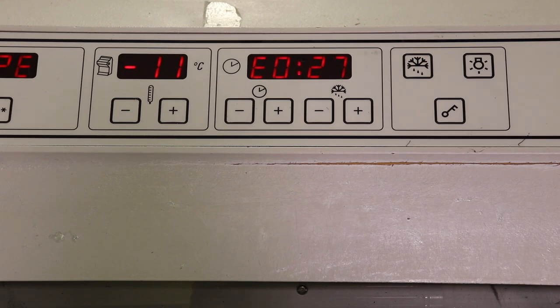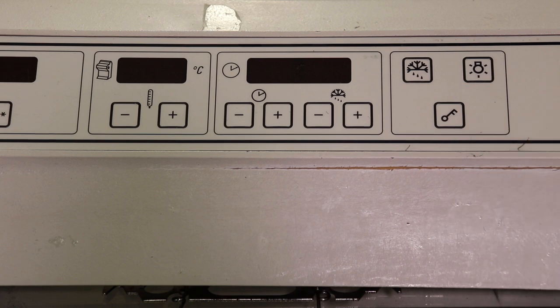Of course, there's always a situation where you can't get somebody out quick enough and you need to use the machine tomorrow. In that case, you can always turn the power off and open the window and let it defrost overnight, and all the ice will melt. When it's done, you dry your chamber out, close it back, and turn it back on. But it's a temporary fix, and I definitely recommend getting the sensor replaced at some point.